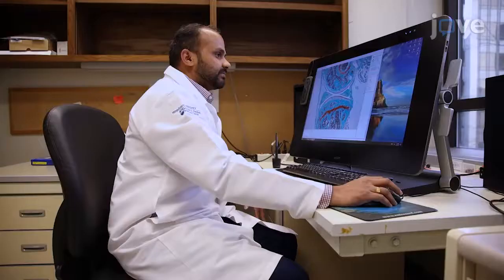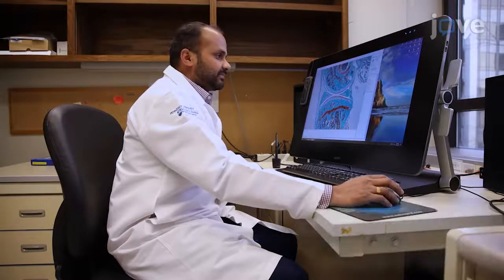Our protocol can also be applied to other osteoarthritis models or areas of musculoskeletal research in which quantification of cartilage and bone is needed. Although the system is straightforward and intuitive, training sessions are still necessary to practice obtaining measurements in a repeated manner to achieve reproducibility. Vengadeshprabhu Karuppagounder, a postdoctoral scholar from our laboratory, will now be demonstrating our procedure.